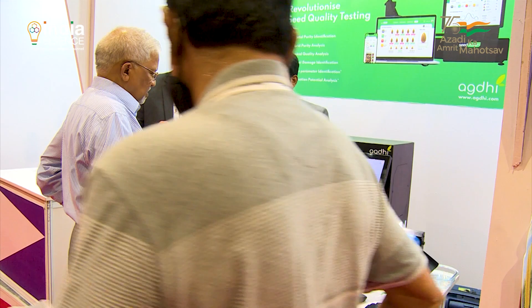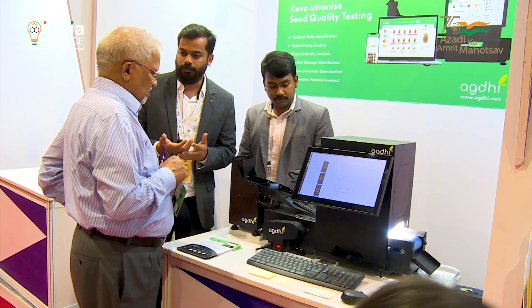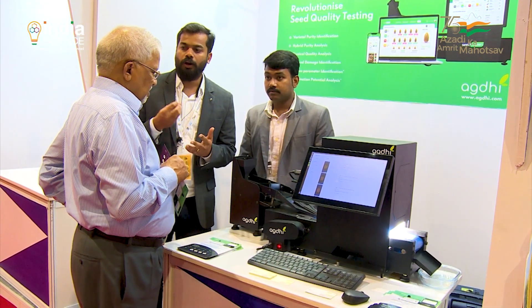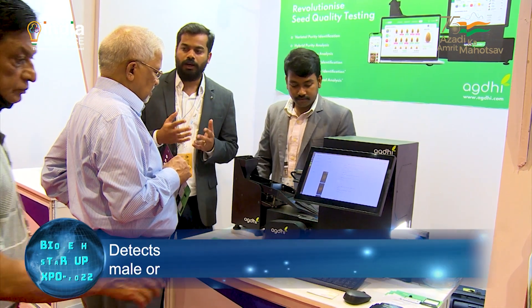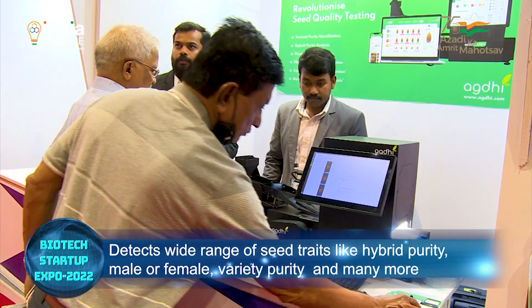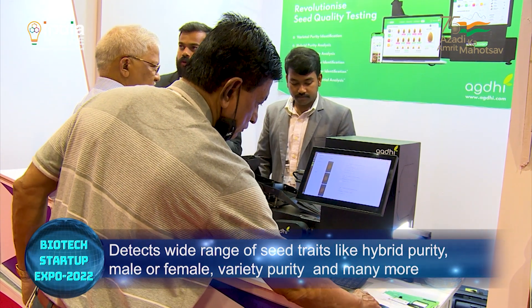How this system works is we will have a training phase. When developing a model for the hybrid, we will take the samples of the hybrid — 10,000 samples. That data is fed into the system and the training of the system is completed.